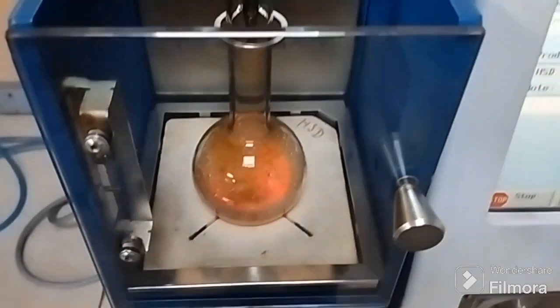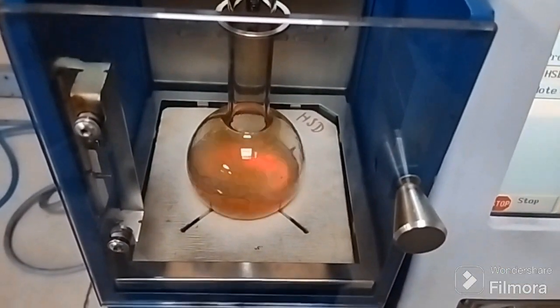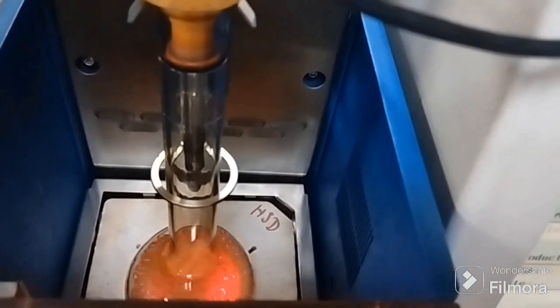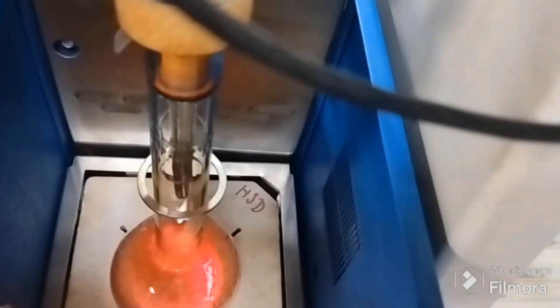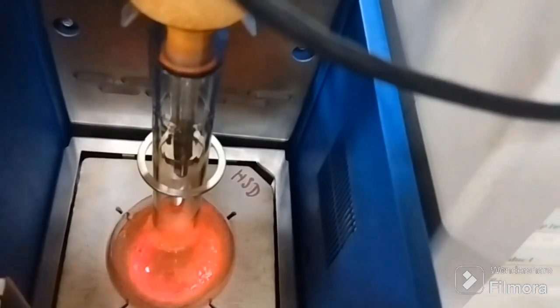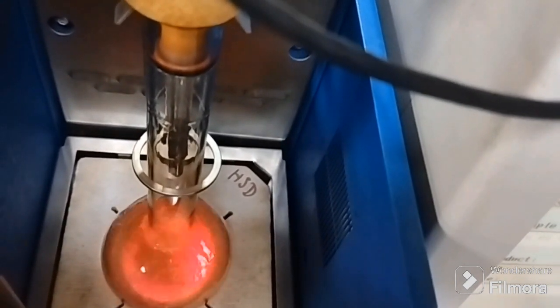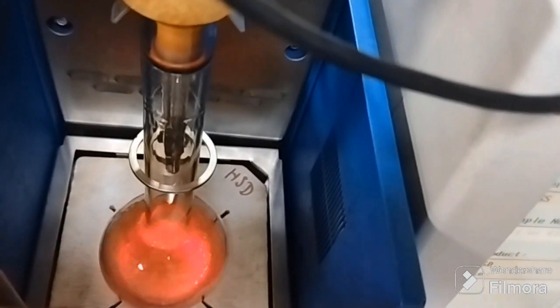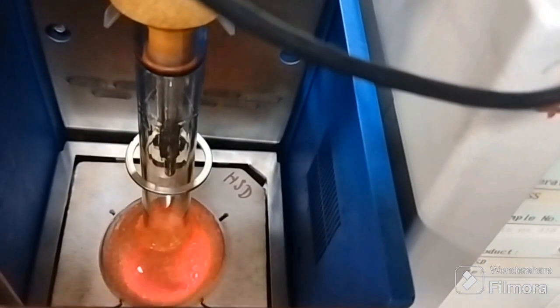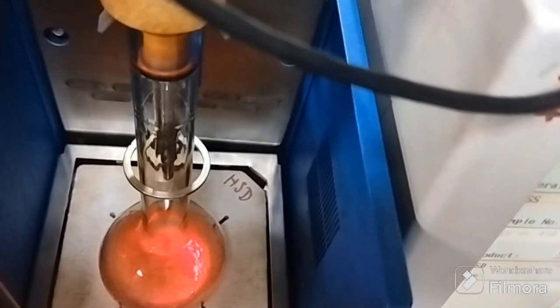Now here, the white surface that you can see with the cross hatches is called the base plate, right? We have the heater, and this base plate is changed as per the sample so that we can provide controlled heating to the distillation flask that we have.